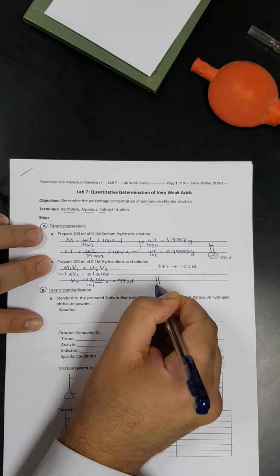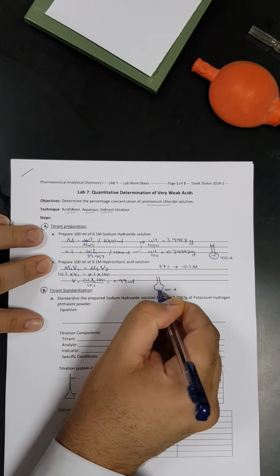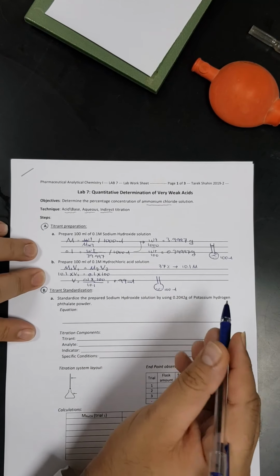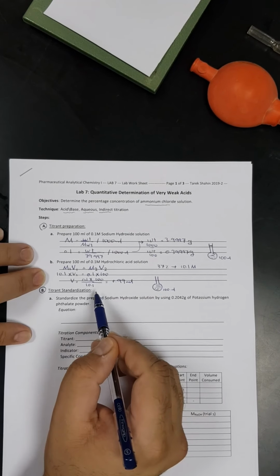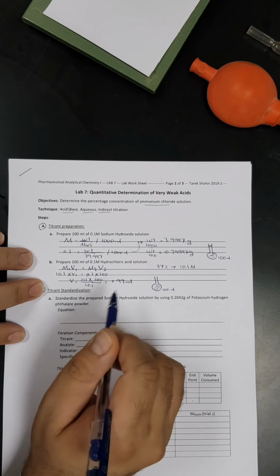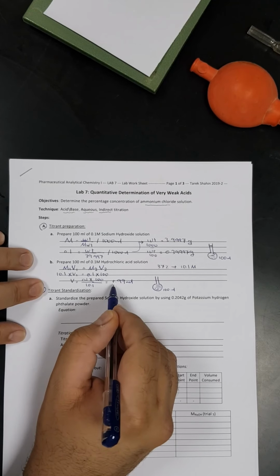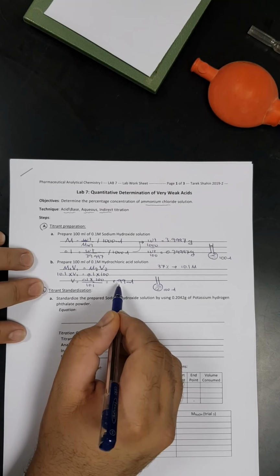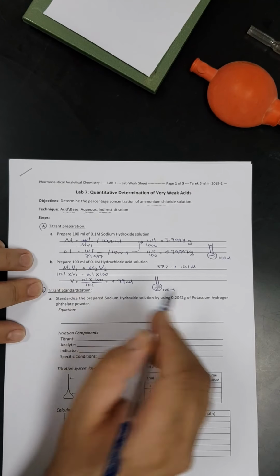Once again, we will get our volumetric flask with total capacity of 100 ml. Then we are going to put here the 0.99 ml of HCl. Then we are going to dilute it using distilled water. Of course, if we have a huge amount of HCl, we cannot add water to acid. But in this case, if you notice, we have only 1 ml of HCl, so it's safe to add water to acid. But the usual and standard procedure we have to follow is addition of acid to the water, not the reverse.